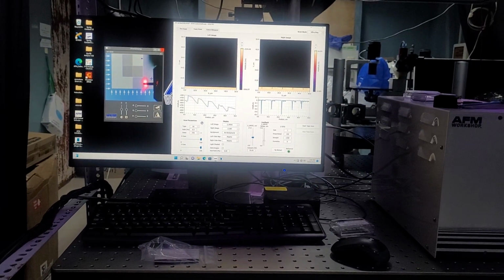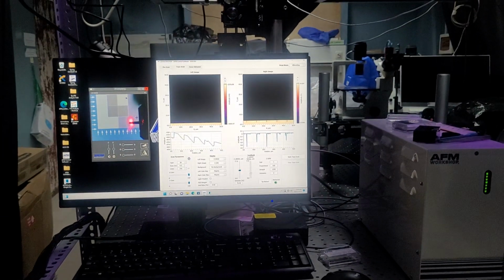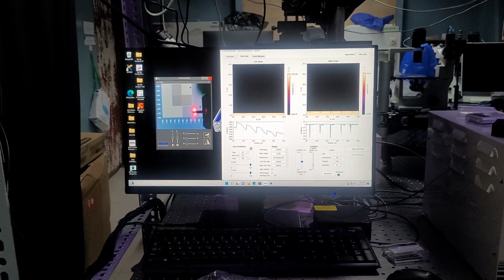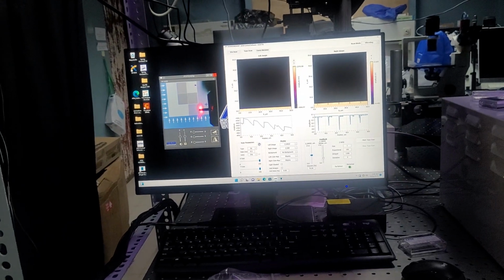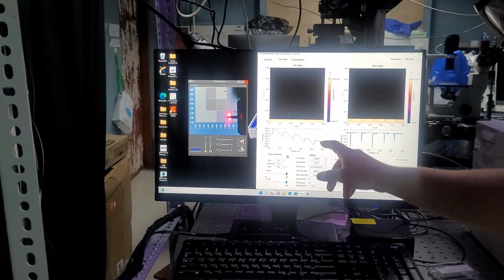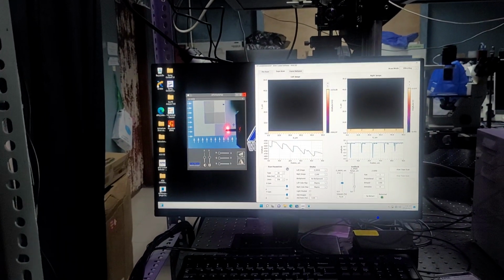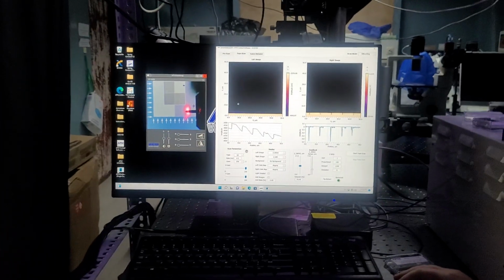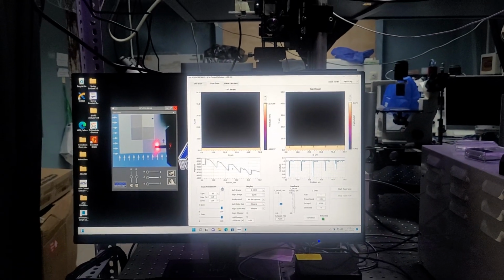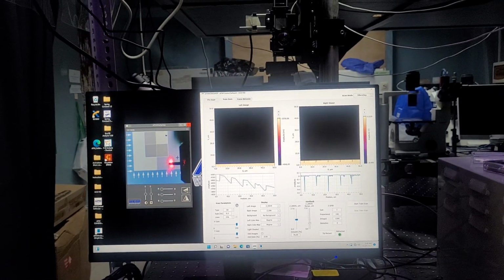Especially, you have to keep in mind how many different things go into not only the AFM but also the samples. So the metal disc that the test sample is on, the dot of adhesive epoxy that holds that silicon chip on, as well as the actual flatness of the chip. So I think overall, in this case from right here, it's like 150 nanometer pitch from high point to high point. But this is going to be the data that is actually saved from the AFM. It's going to be the raw data, the unleveled data, and then from there you'll be able to open it in Gwyddion and get a better idea of what exactly it looks like.